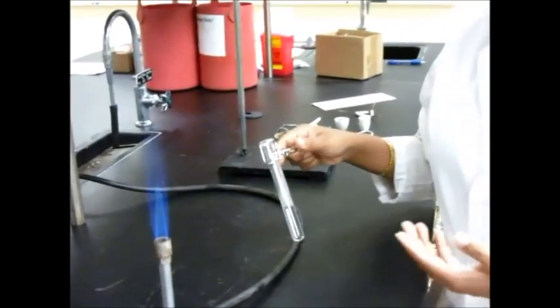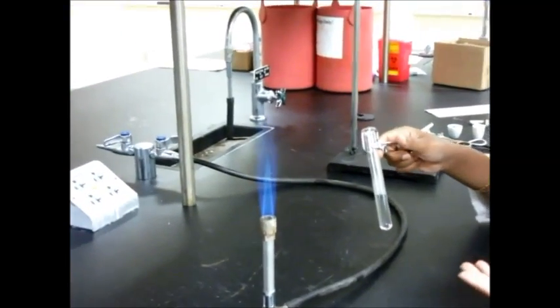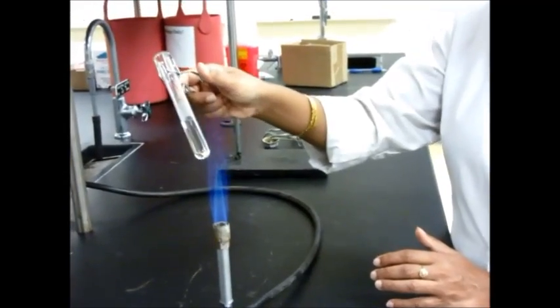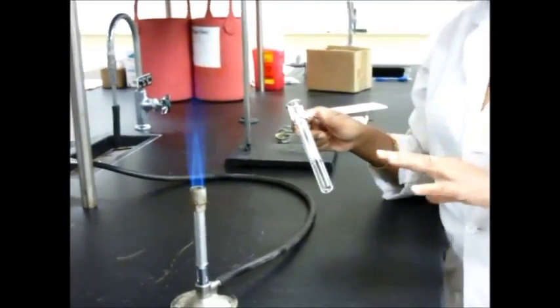Then read your procedure and see if you need it on a hot flame or if you need to heat the test tube on a cool flame, because the hot flame is going to heat it up really fast, and a cool flame will provide a little bit less heating to the test tube.